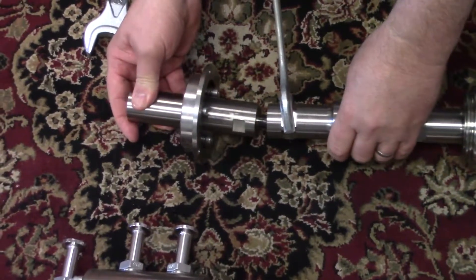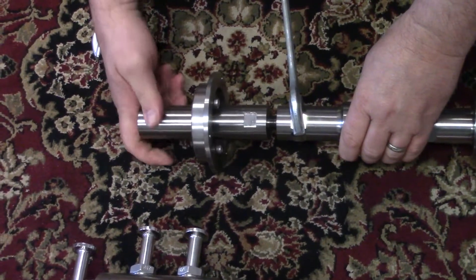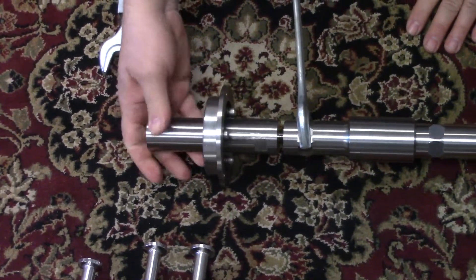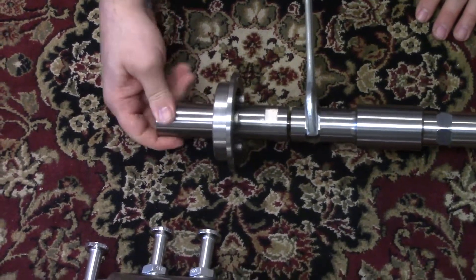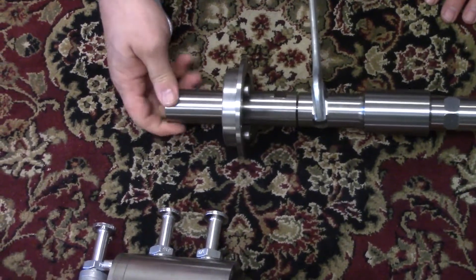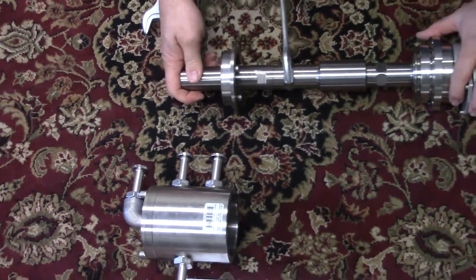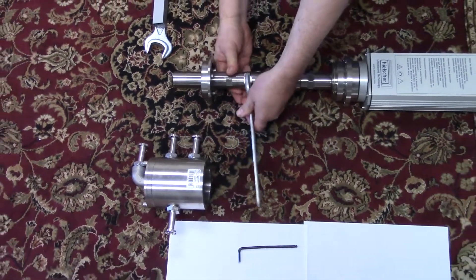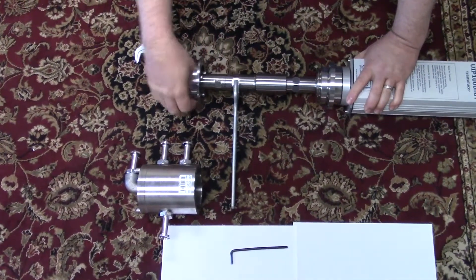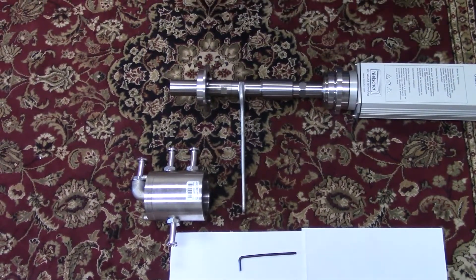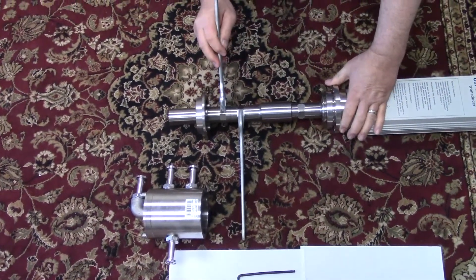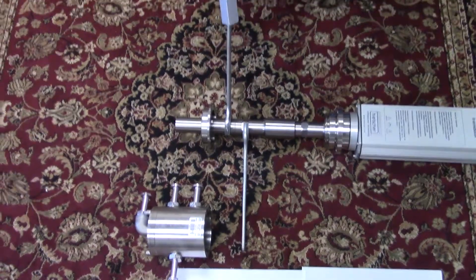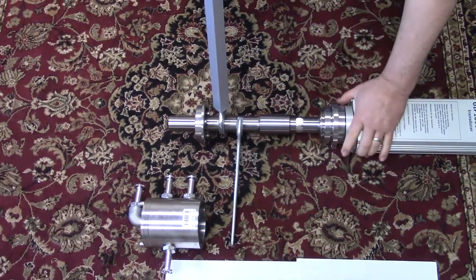I'm turning the unit clockwise. Now reversing the wrench to the other side and then tightening.